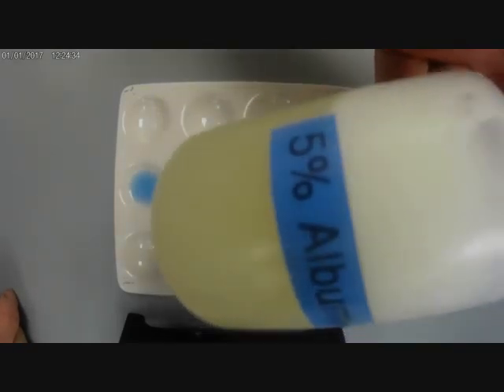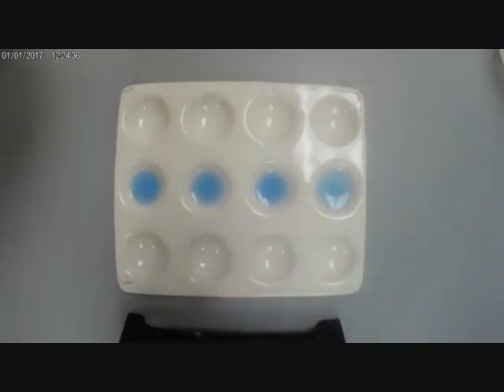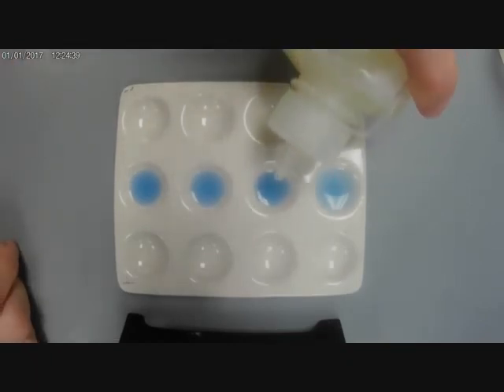My next solution is albumin. This is egg white. I'm going to put a few drops of this into the second one.